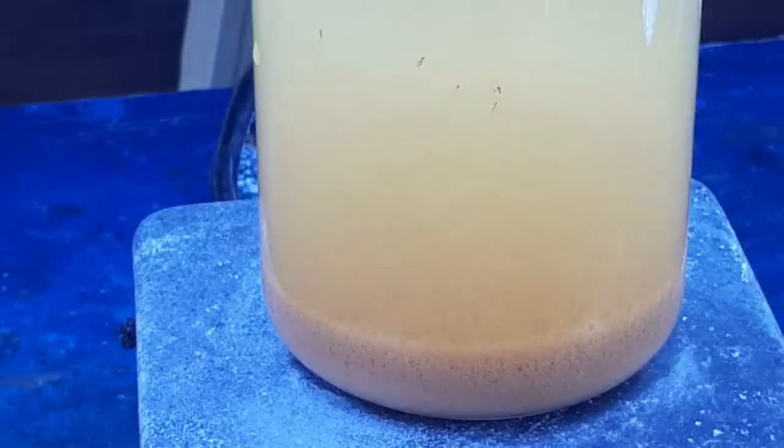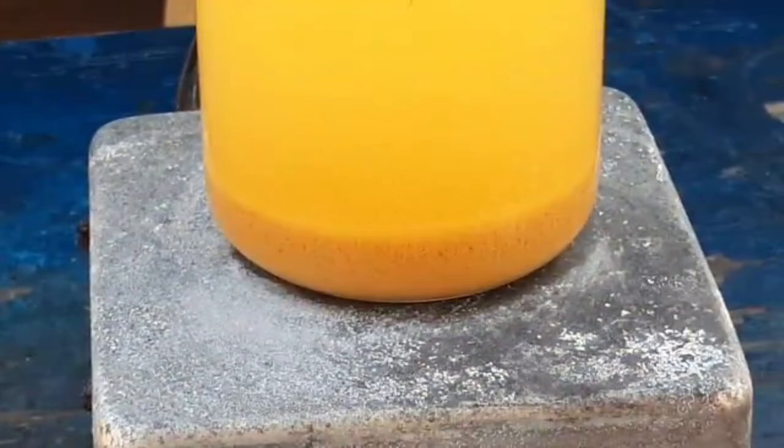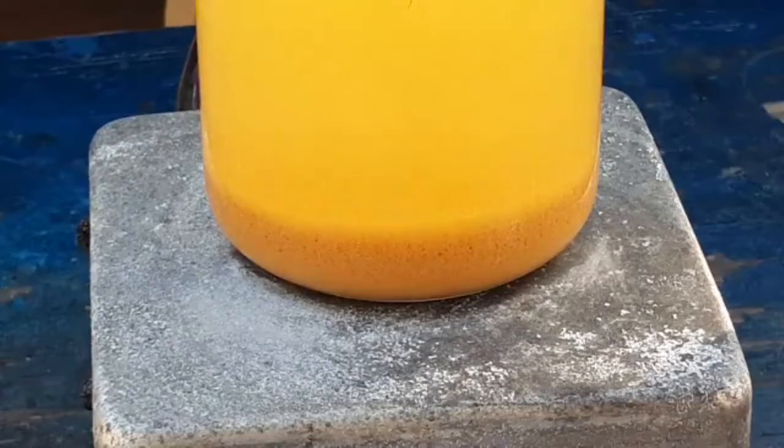So I finally decided to add more HCl in there — and what do you know, it dropped right out. This is much more in line with what I saw online. I don't know which isomer this is — is this yellow-brown or is this orange? I don't know, I don't care. We got an isomer of it. I am reasonably certain this is correct. It's insoluble, it's about the right color. We added enough HCl to get it right. It's not a light yellow, which Wikipedia says we'd get if we had added too much. I think this is it. I think we have succeeded.